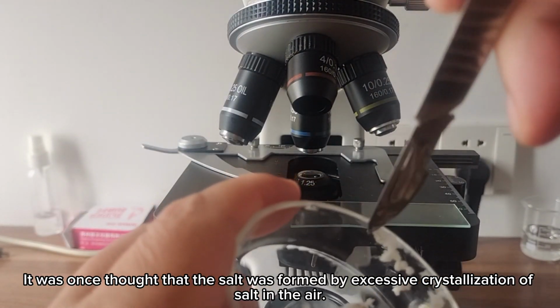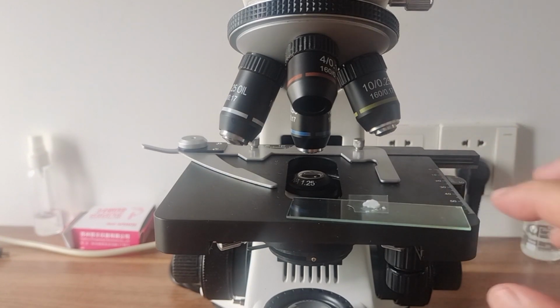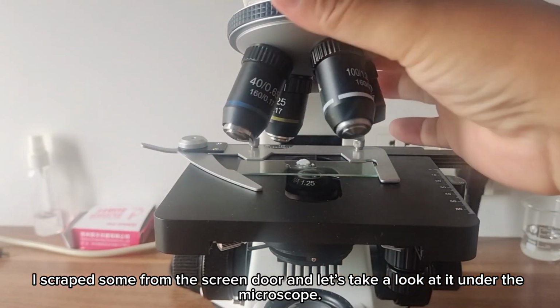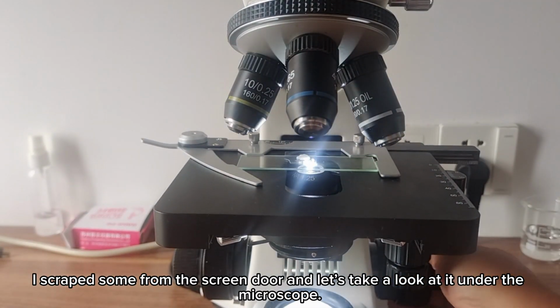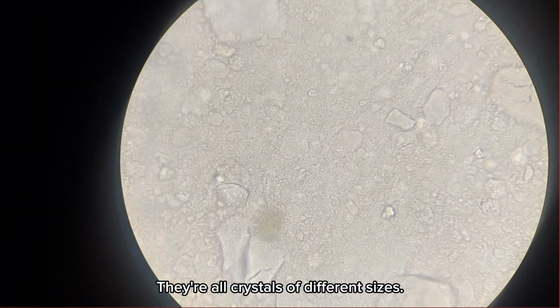It was once thought that the substance was formed by excessive crystallization of salt in the air. I scraped some from the screen door, and let's take a look at it under the microscope. This doesn't look like salt crystals. They're all crystals of different sizes.